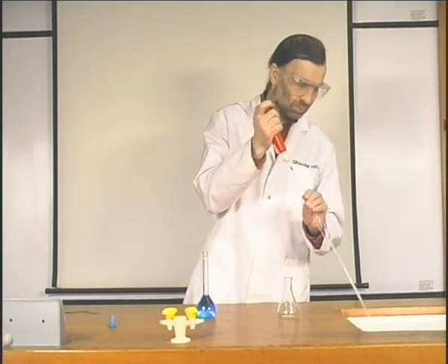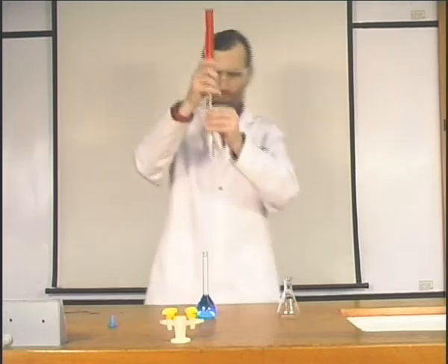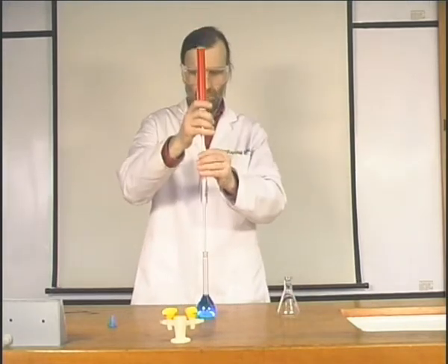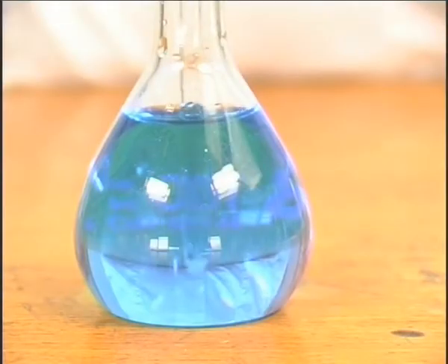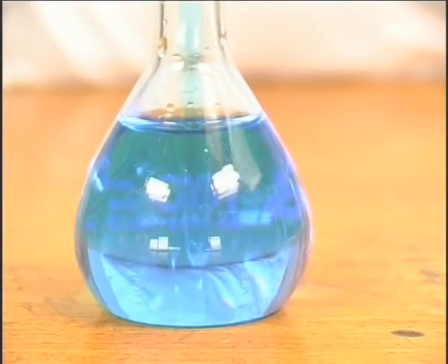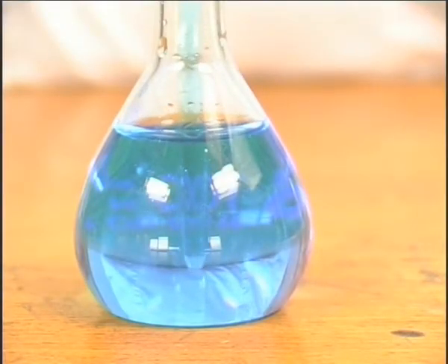The pipette filler is reattached and the pipette is filled with liquid. Always ensure that the pipette tip is well below the surface of the liquid.